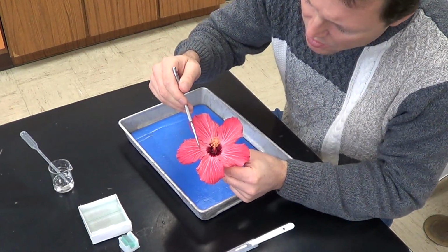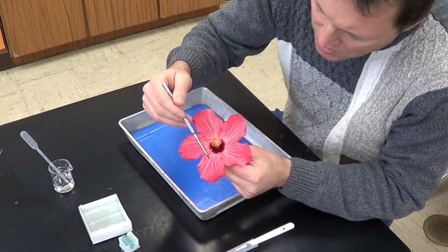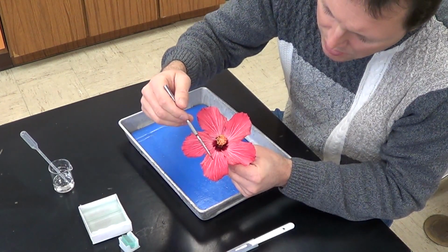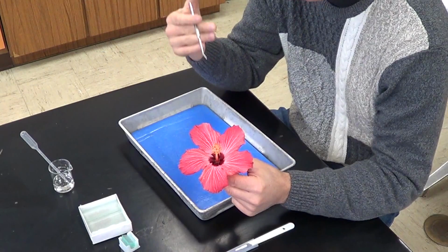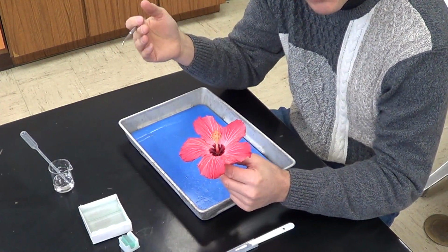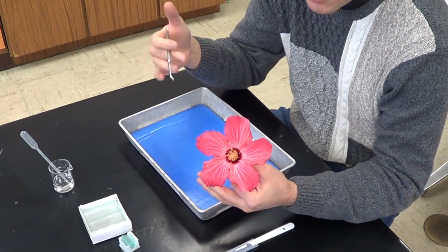You can see the veins of the leaf. So look at the vein. You've got white veins here of the leaf. You can see that these veins actually branch. If you look closely, the veins actually branch. And whenever you have branching veins, that's an indication that you're working with a dicot. If these veins were all parallel, like they would be on a piece of grass, a blade of grass, then that would be an indication that it is a monocot.